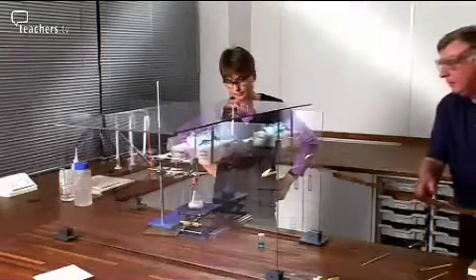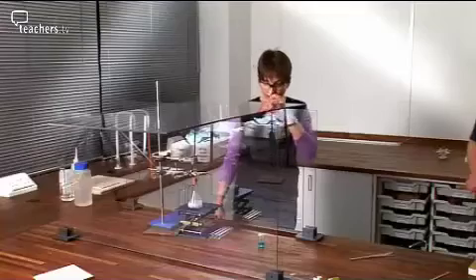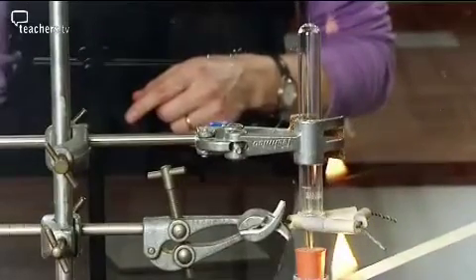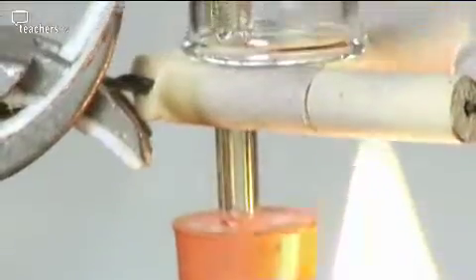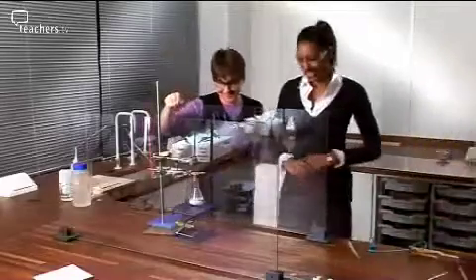The wrong way to test for hydrogen is close to where it's being generated. Try again, because there should be some hydrogen coming out into the tube now. Sometimes when you try to get something to go wrong, you can't. It's not going to work. Safe to come back? Yeah. Yes. Thank you, Bob.